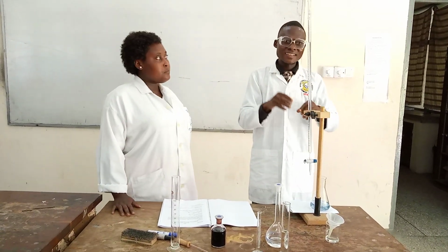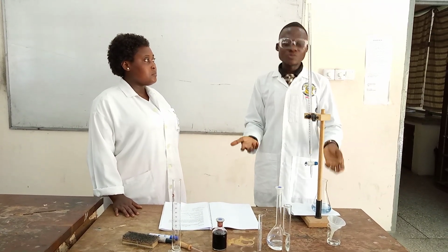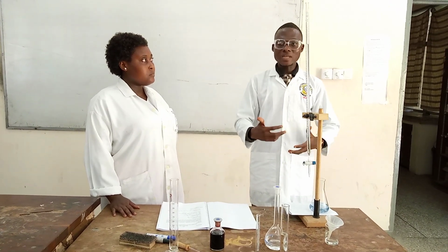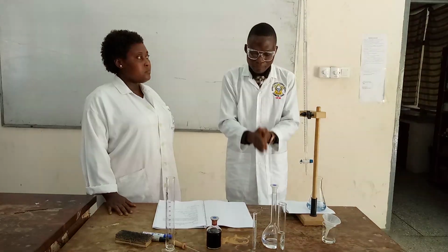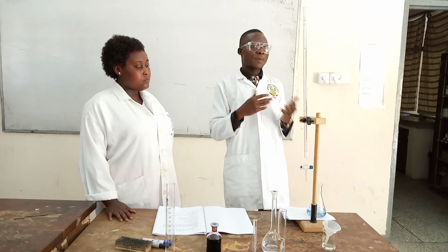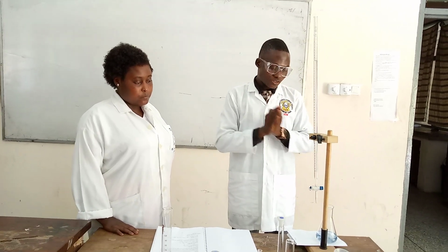So when you are doing this titration, what you need to note is that your endpoint is blue. The purple is only telling you that when you get to the purple color, you should take your time, because a drop can change it to blue. So when you don't see the purple color, it doesn't mean your titration is wrong. It's only a sign that you are nearer to the blue. So take time. But when you get the blue color directly, it doesn't mean you are wrong. You are right. So that is what we had.